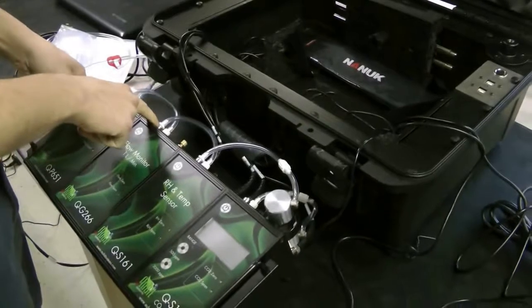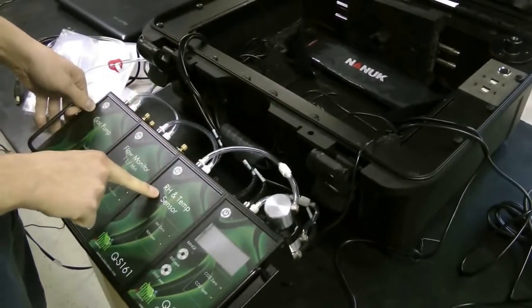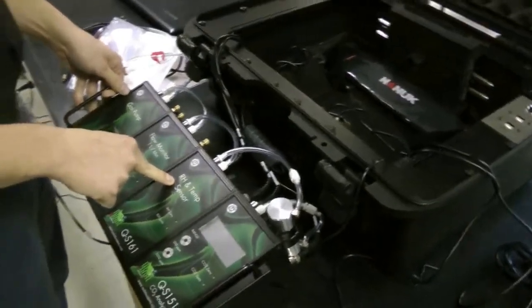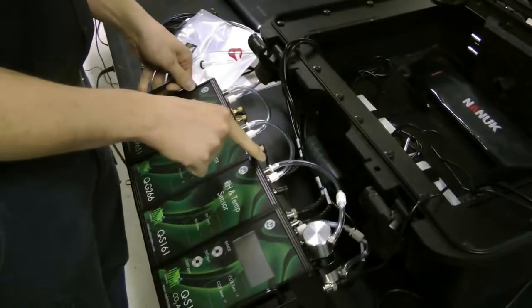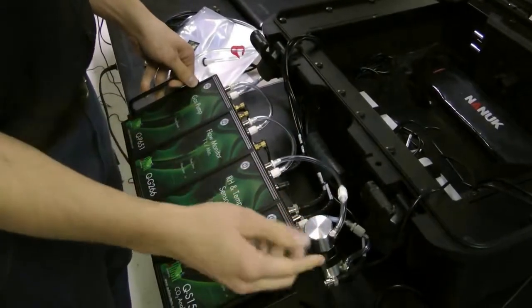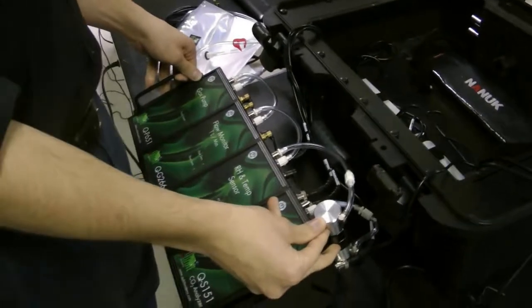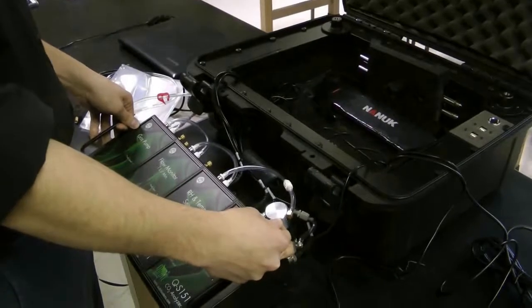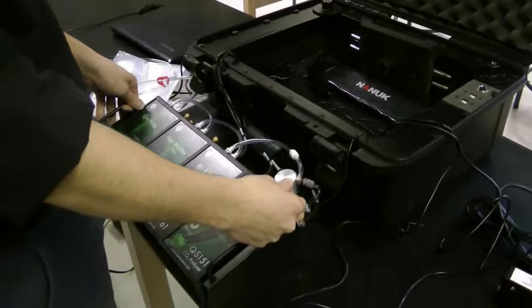The output of the flow monitor goes to the input of the RH and air temperature sensor. These are used to measure the water vapor levels and the air temperature of your plant. The output of your RH sensor goes to the input of this drying column. This drying column is filled with desiccant, and if it expires or becomes too moist, it will change from blue to a pink hue. There's more of this desiccant included in the QBox accessory kit.